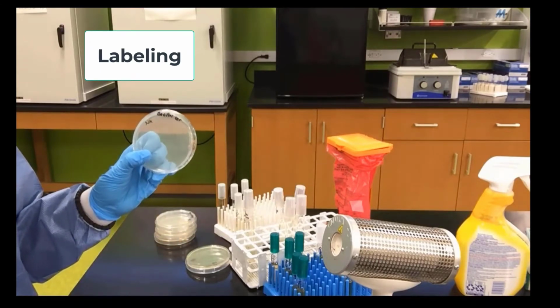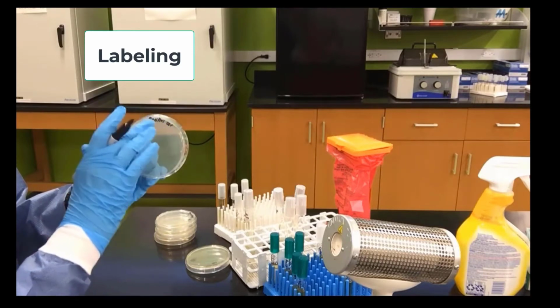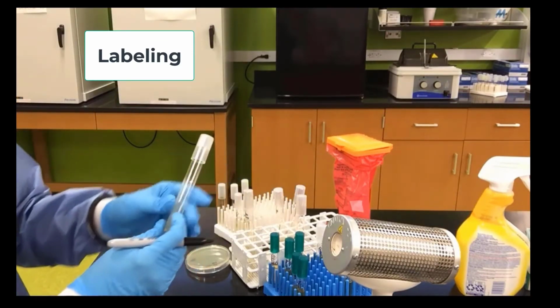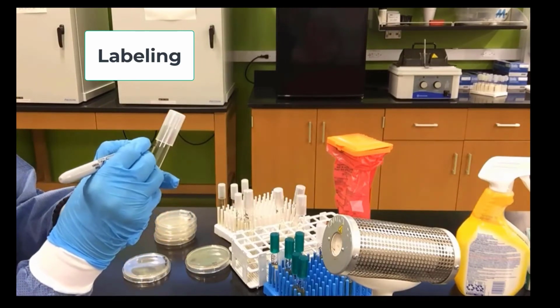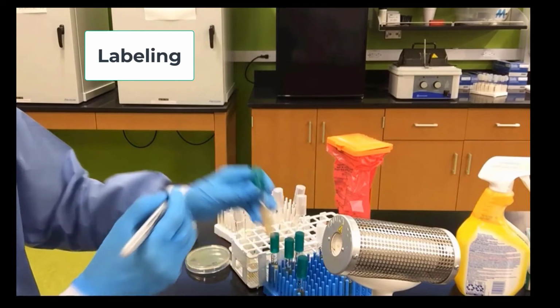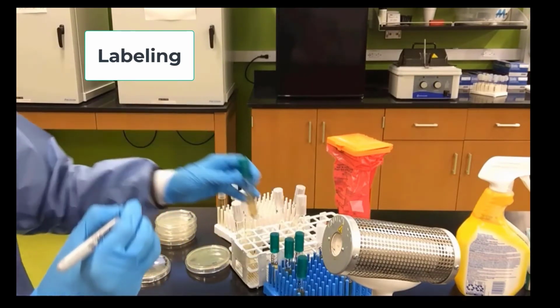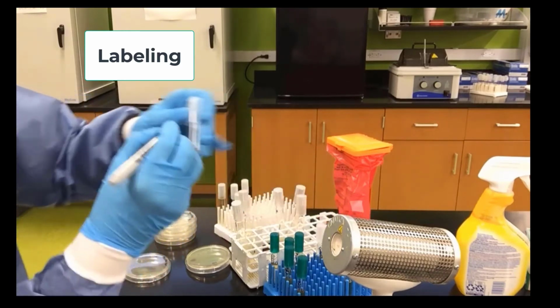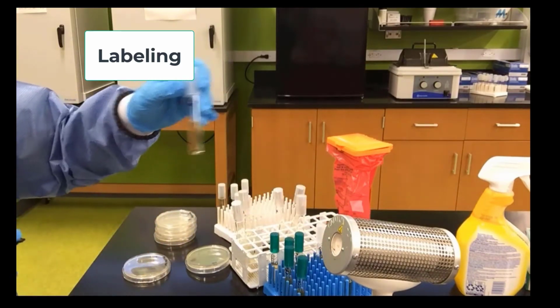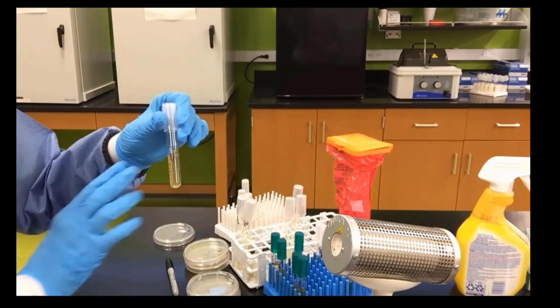I want to stay on the perimeter, or the periphery as we say, of the plate out here. I will also label an Agar Slant for Bacillus cereus, and I will also label a gelatin for my Bacillus. I also will label a liquid for my Bacillus cereus. So you can see that my Bacillus was labeled on 4 different media.